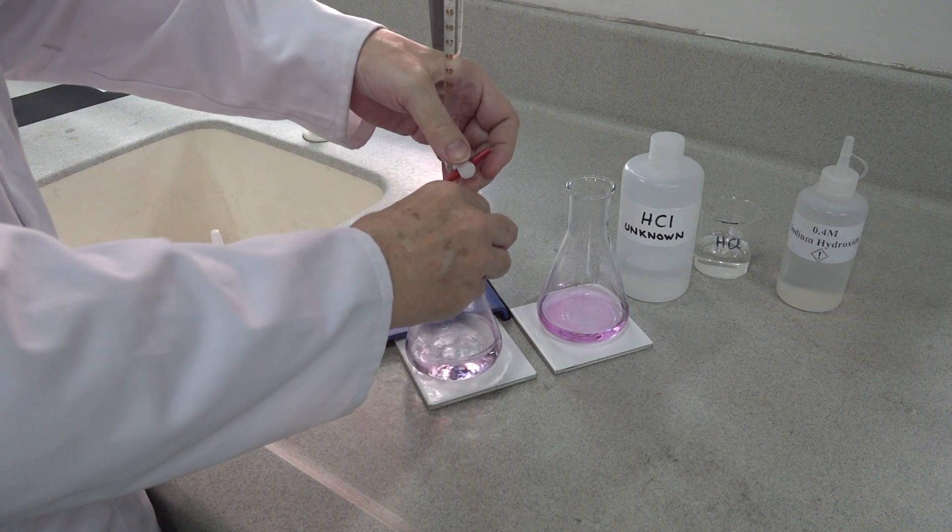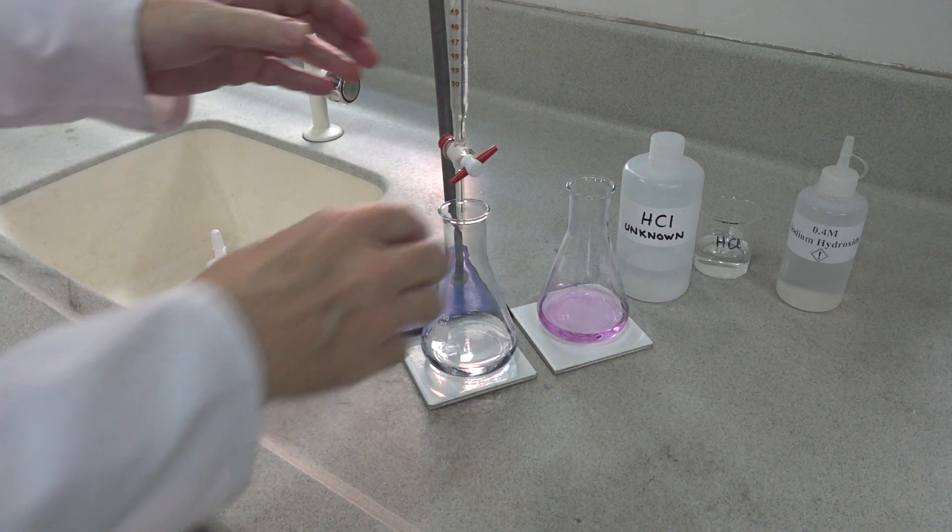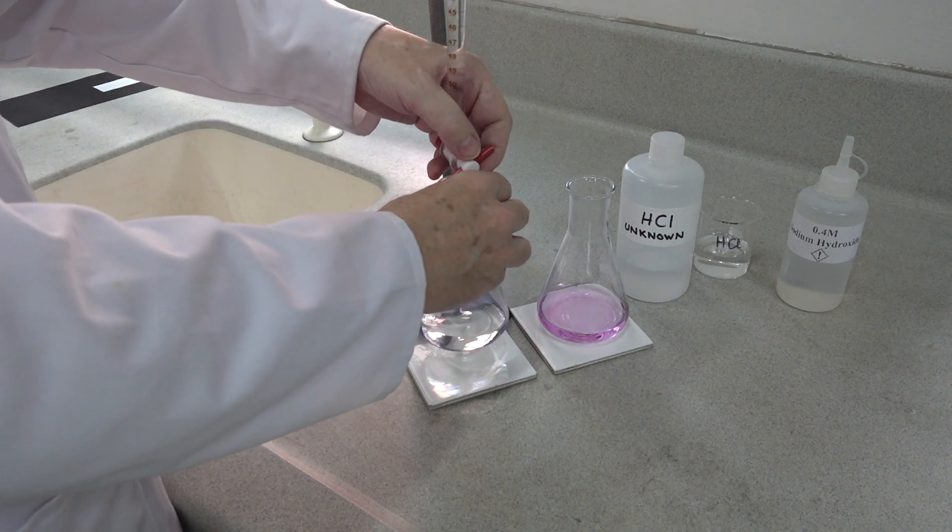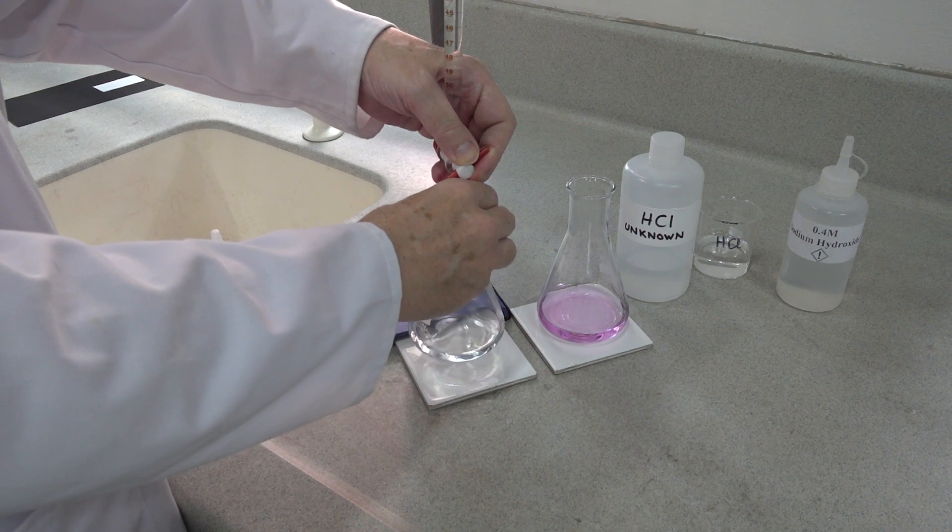There, that was one drop. One drop at the end. Still vanishing. The color has to persist for 30 seconds, remember.